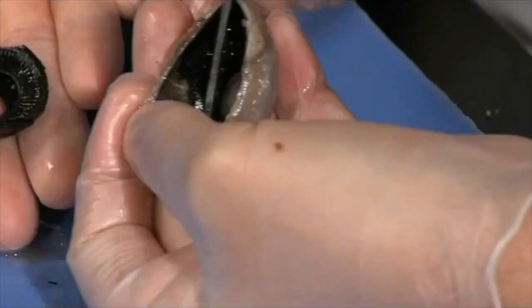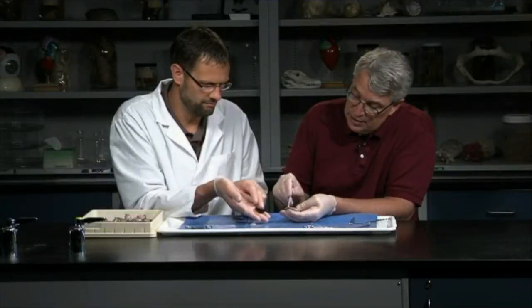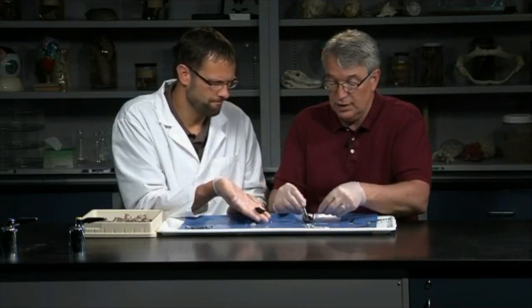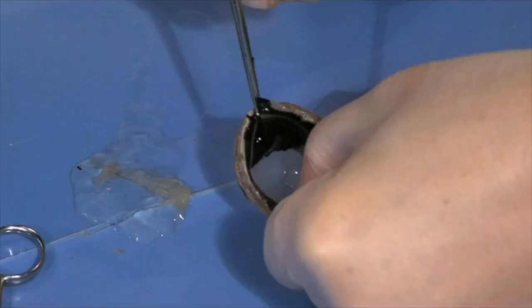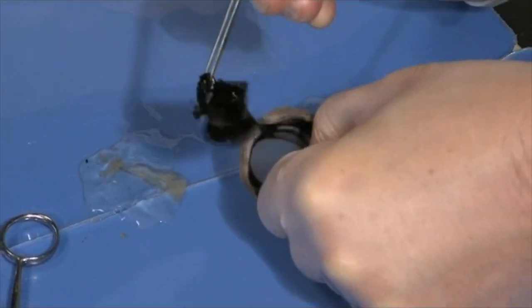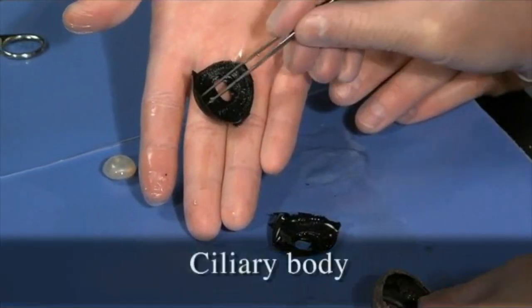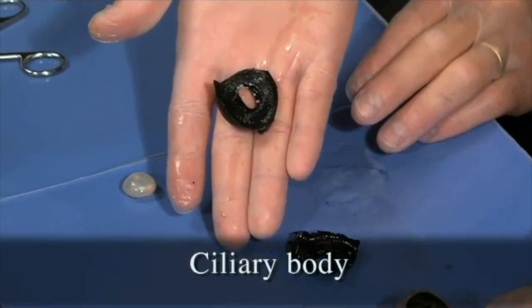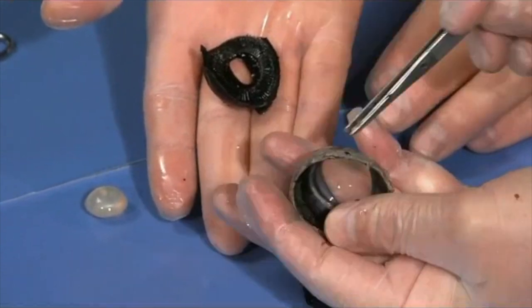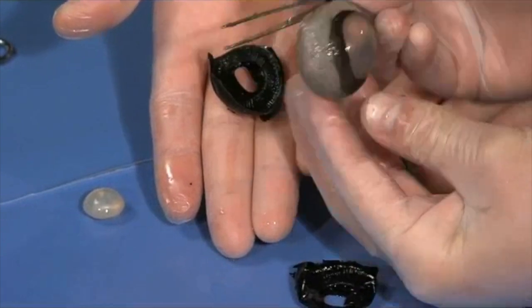It tends to hang on the ciliary body. It almost looks like the choroid is continuous with the ciliary body there. Yeah, I believe they are. Try to hold that. Very slippery. There it goes. But anyway, you can remove that, like the one that Steve has there, and the choroid. You can see here's the ciliary body extent, and it's continuous with the choroid. And then when you take that all out, there's the sclera left. You can see where the sclera coat is continuous with the cornea.